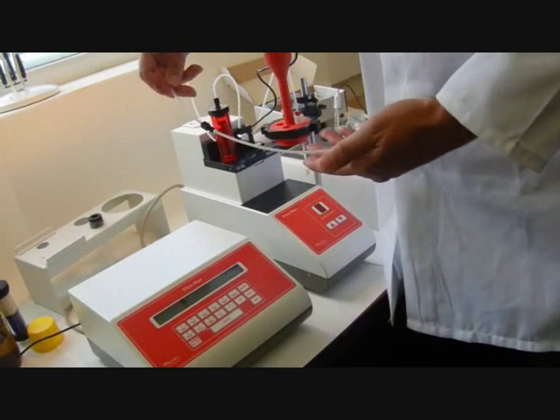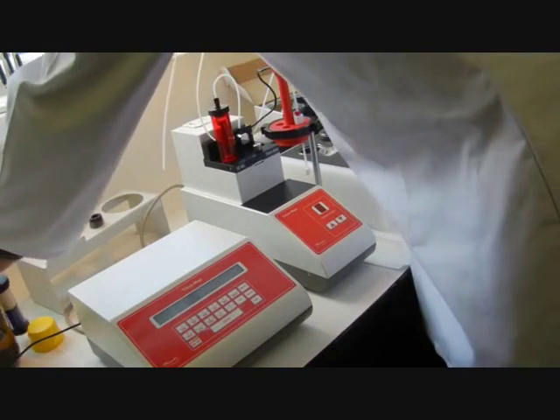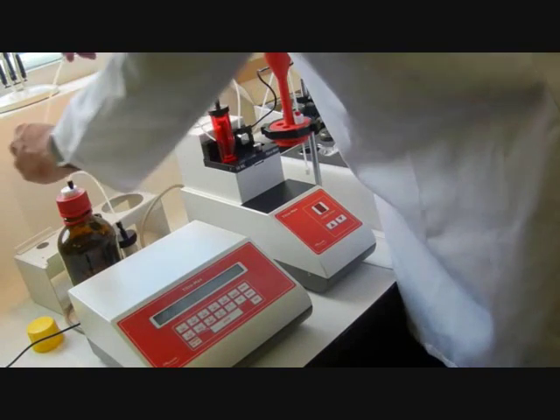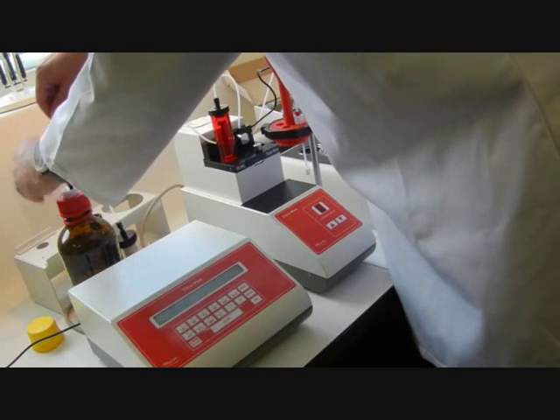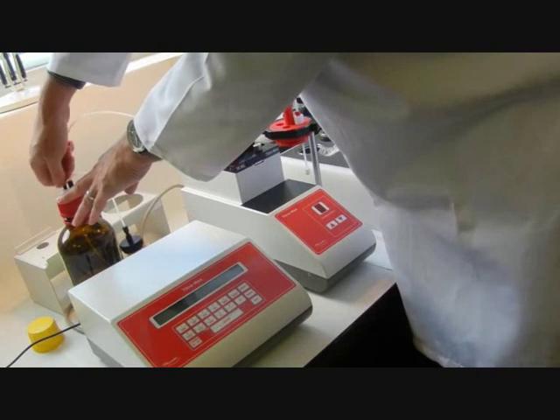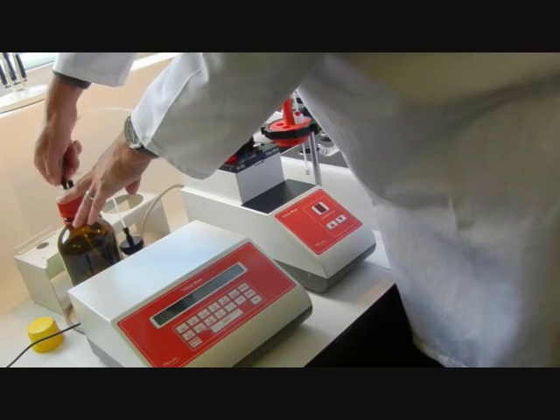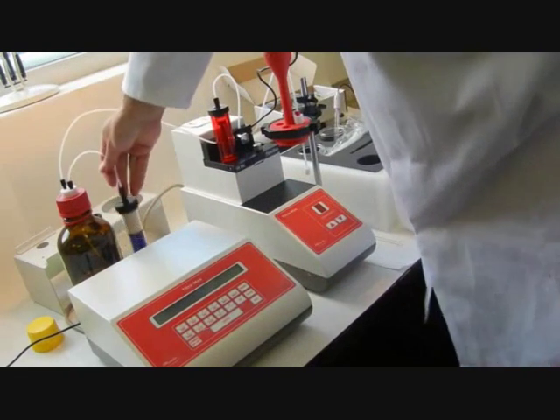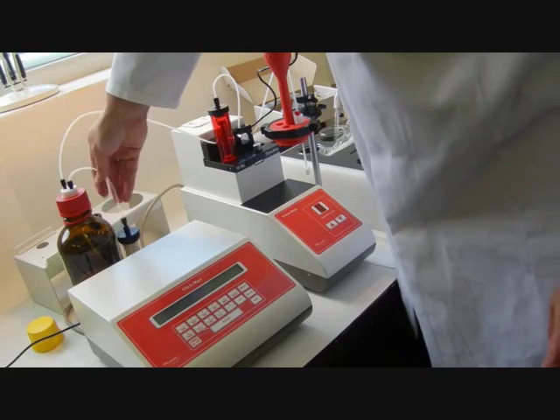The tubing which goes from the burette into the titrant bottle can be fitted. Push the tubing right to the base of the bottle and screw in. Ensure the desiccant is attached.